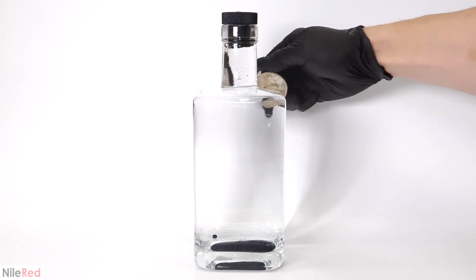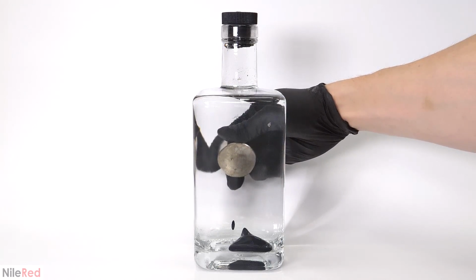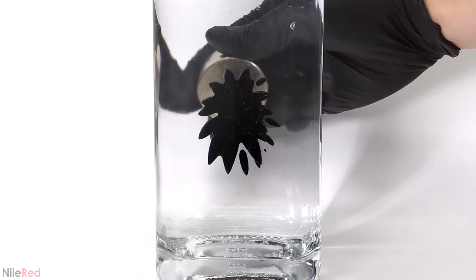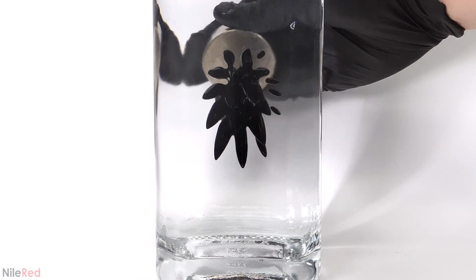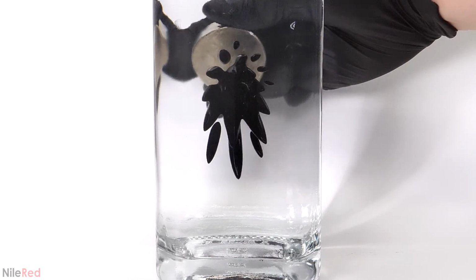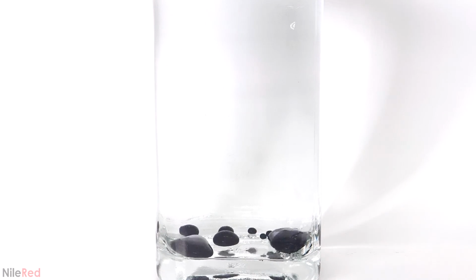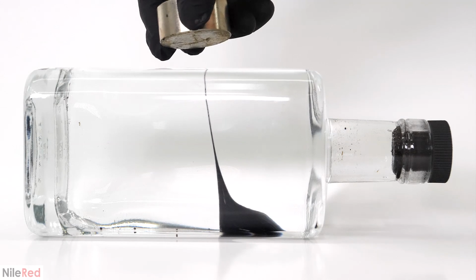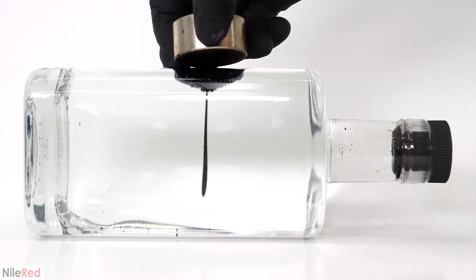I thought it would be fun to scale it up, so I just did the same thing with a larger bottle. However, when I did this, it was obvious that my fluid wasn't as good as some of the other runs. While it did still work and look cool, the spiking wasn't very good, and I also noticed that there were a lot of bubbles stuck in it. This made it look a bit chunkier and not as smooth as it should have been.